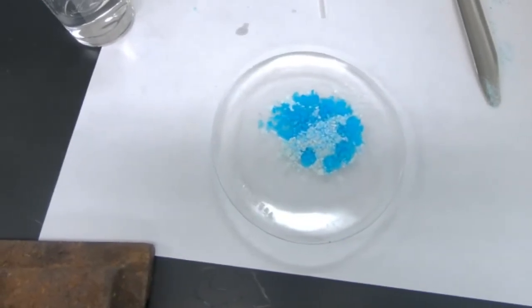Okay, switch video. Let me secure that camera there. So, folks, what we saw there were some physical and chemical changes. Make sure that you complete that table. Wrap up your observations. In that last column, it says new substance formed. You should only choose that if you thought this was a chemical change. And once you're all set up there, feel free to ask me questions.